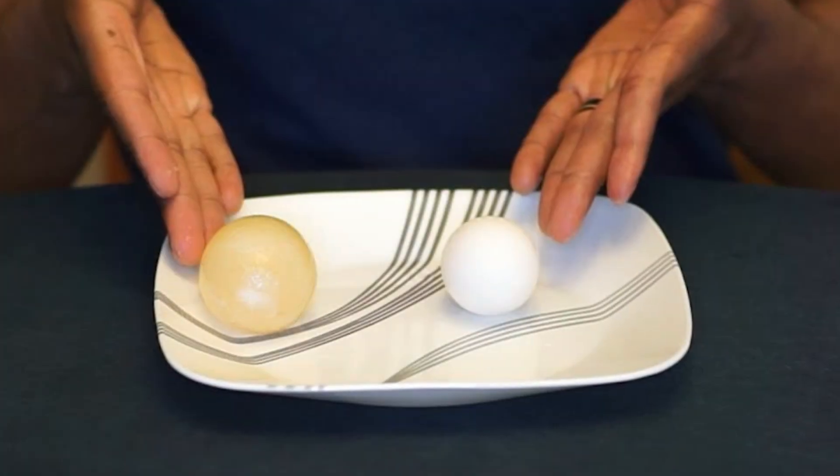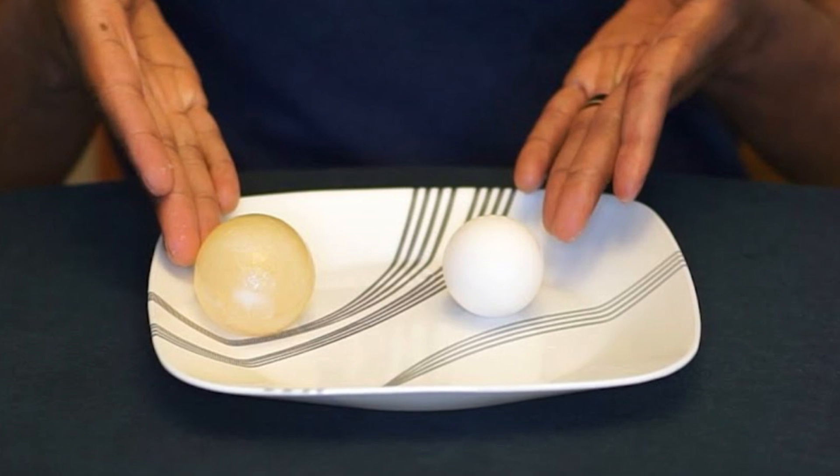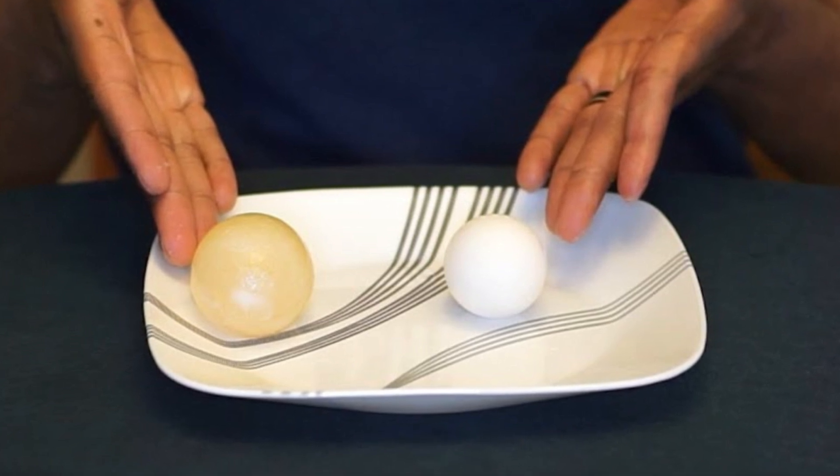Observations: Take out the eggs from the solutions and observe the size of de-shelled eggs carefully.